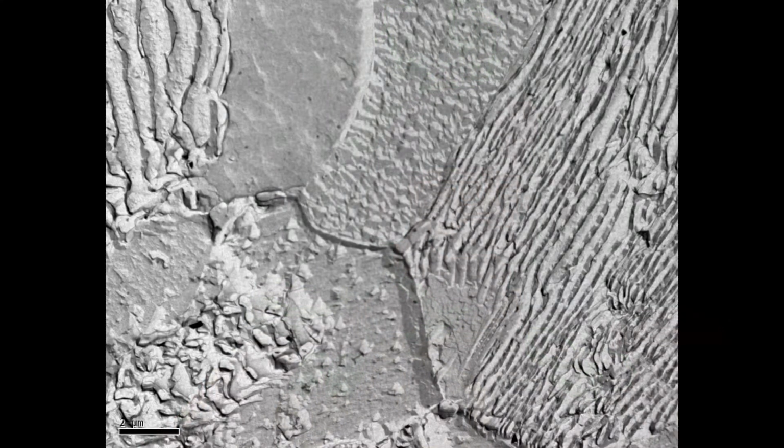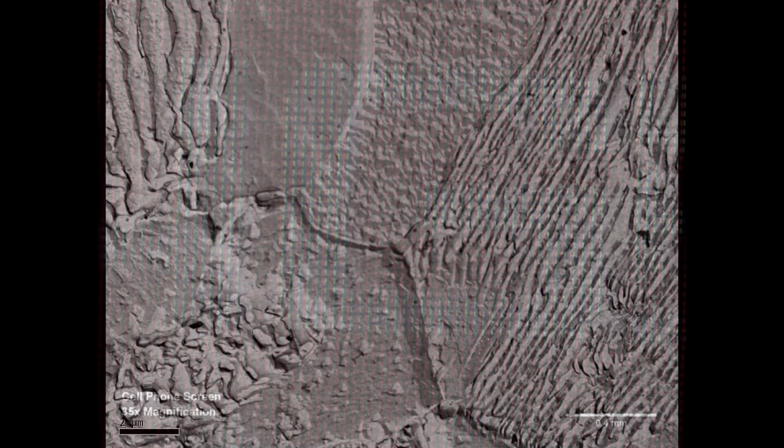What is electron microscopy? Put simply, it is the usage of electron microscopes. For those unfamiliar with this field of science, electron microscopes are powerful microscopes, some of which can even see atoms. What I've been studying at Delta was how to operate, maintain, and prepare samples for these amazing tools. The best part about the program I went through is that they had electron microscopes there for students to work on, and this is at a community college no less.